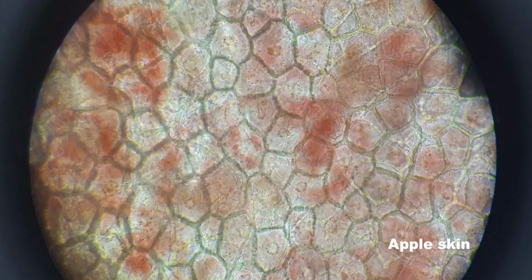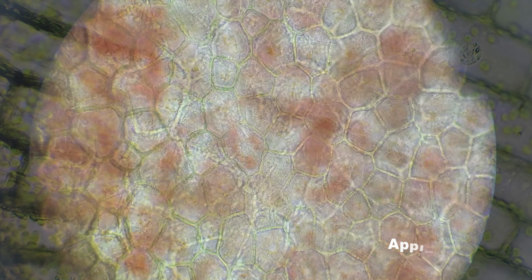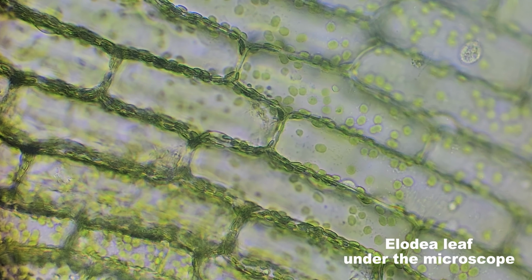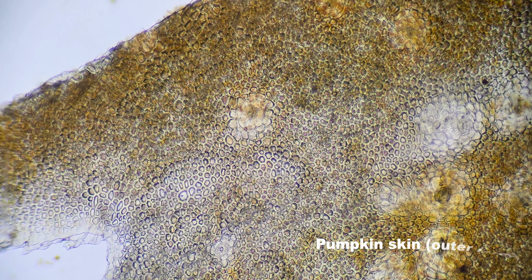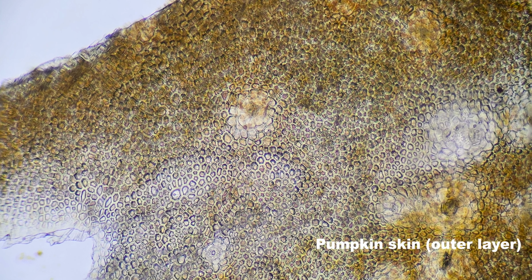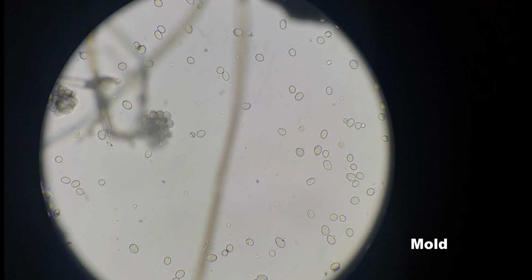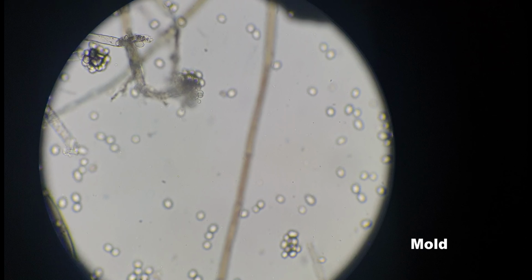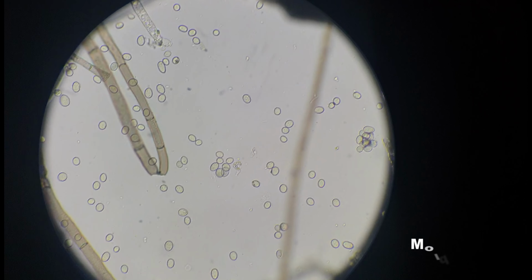Microscope images follow their own rules. We're dealing with a very shallow depth of field, meaning only a small part of the image can be in focus at any given time. That's why a single photo is often not enough to capture the whole object we're observing. Additionally, lighting, reflections, dust on slides, or even slight image shifts can cause so-called artifacts, which distort the true appearance of the sample.